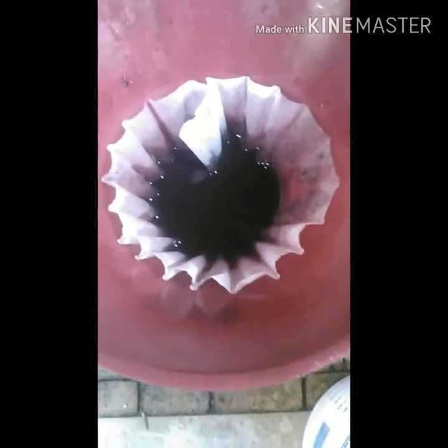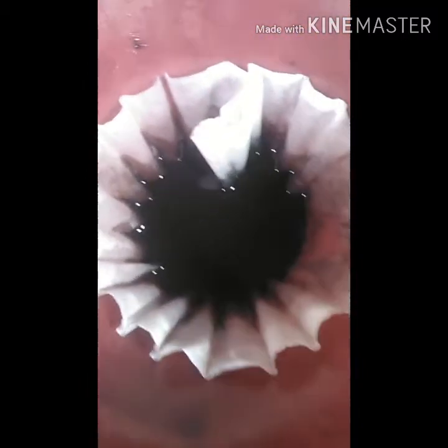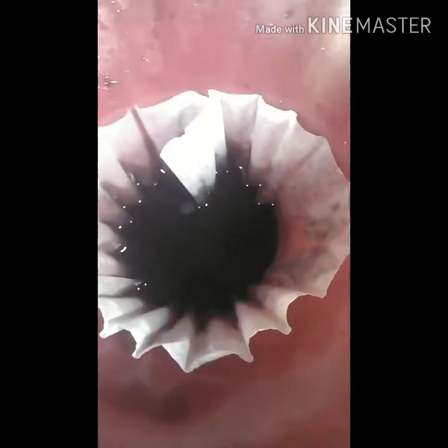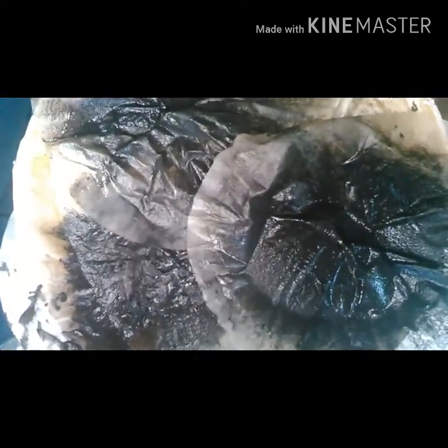I'm down to my last filter run. Here's what the other two filters I took out look like — they're pretty packed, or caked rather. This looks like a pretty successful run. Once this is done, I'll get them out and dry them. There's my three filters. That's the one that definitely has the big cake in it. Not too bad for cleaning out of filters.